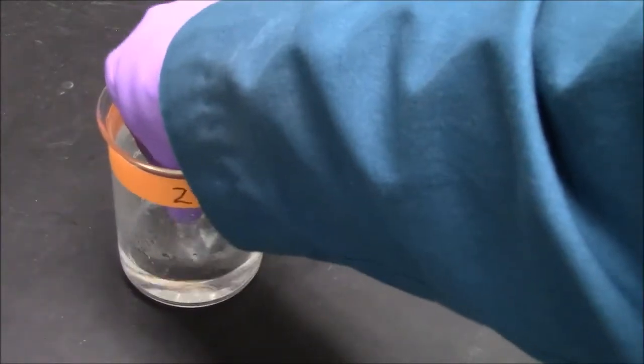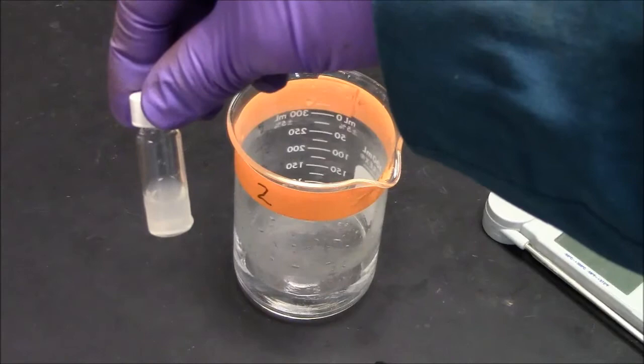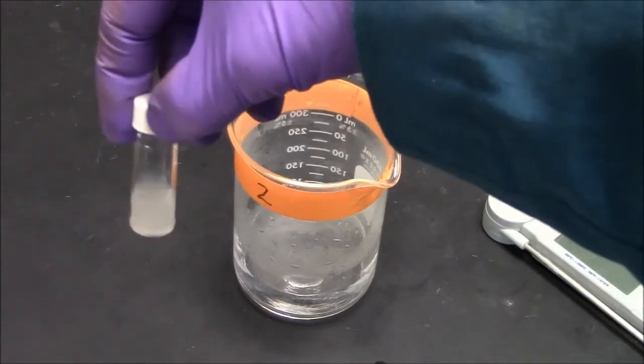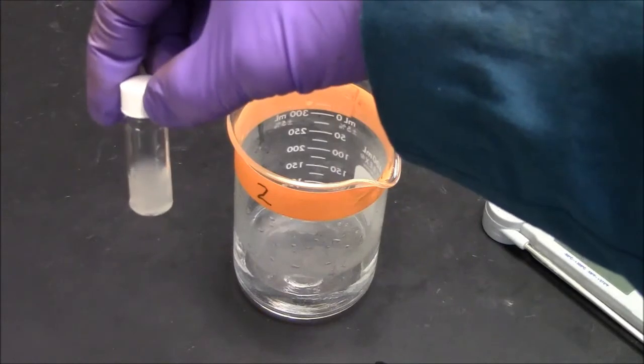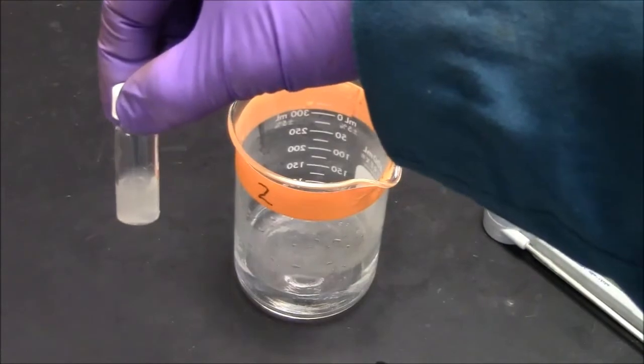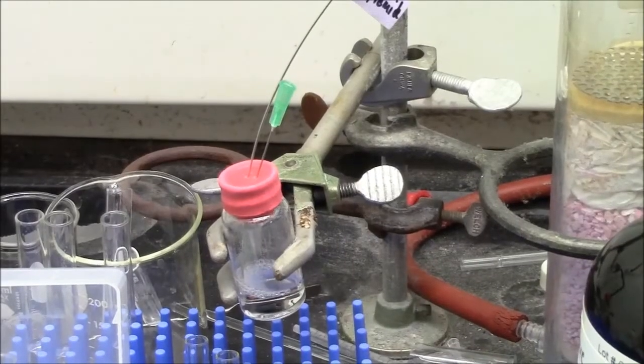All right, so I am just shaking my vial in the warm water. You can see here I am getting a significantly hazy suspension, so I know that there are nanoparticles in here, and the temperature changes making them go through a phase shift, which makes them more visible.